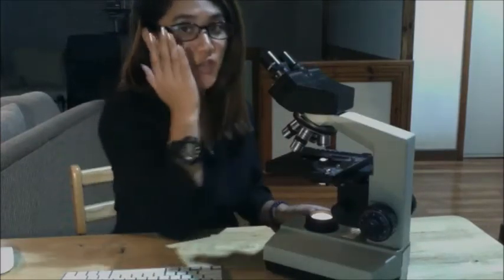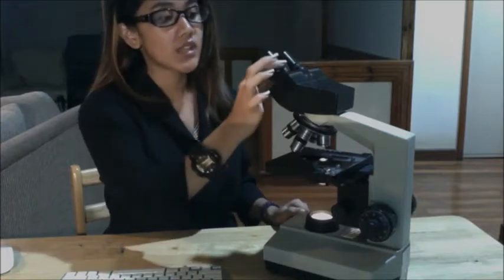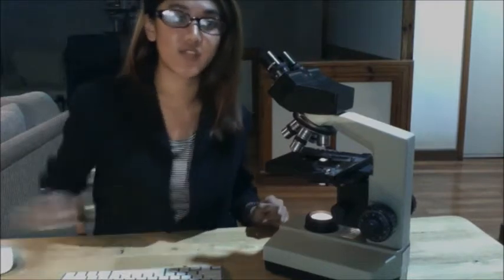So now that you have already adjusted your binocularity, you could now adjust the focus of the eyepieces. Take note that the right piece is fixed, but the left one has telescoping capabilities. In order to do that, you have to first cover or close your left eye, and then look through the right eye once again and bring the object into focus by turning the fine adjustment knob. Then, cover your right eye, focus the specimen with your left eye by adjusting the telescoping knurled knob on the left eyepiece, which would be the one that has your telescoping capabilities, and then the microscope should now be in focus for you as an individual.